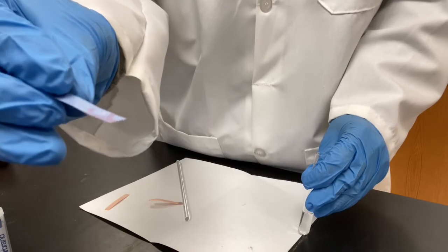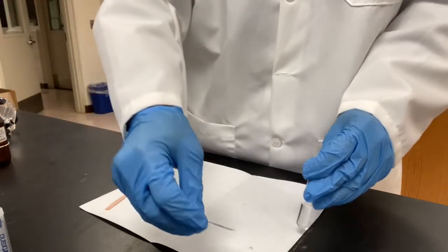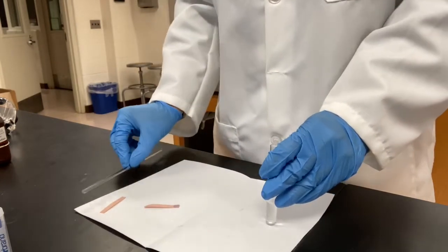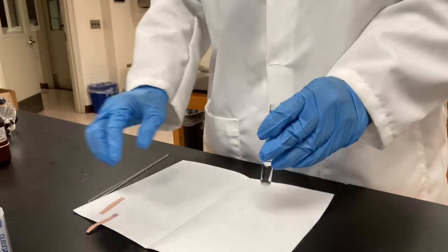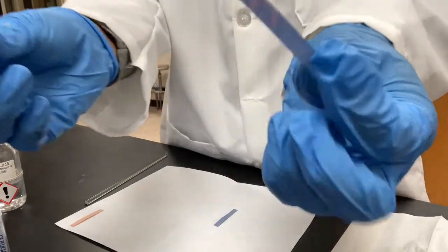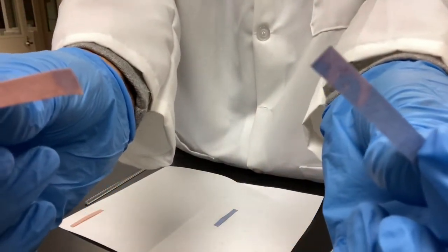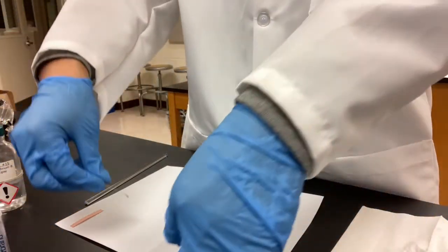What does change to red mean? Right now, this is the color. Okay? So when you record this observation, you can write down color changed a little bit. I'm going to keep these 2 pieces of papers here so we can do a comparison later on with other papers.